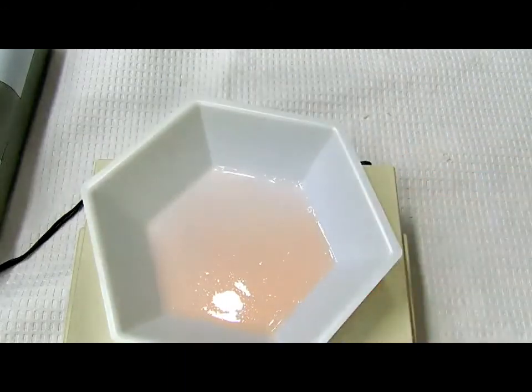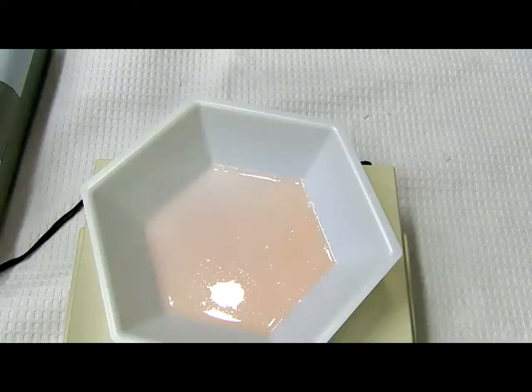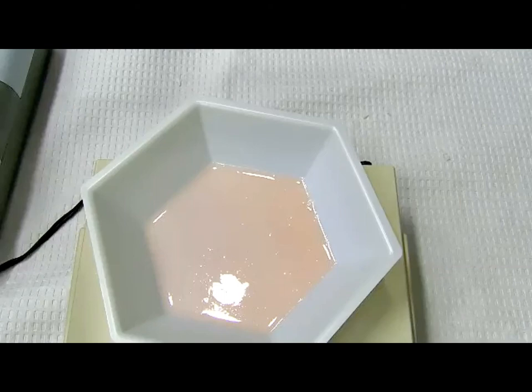And then lastly, you'd want to describe it as easily redispersible. So pink, odorless, opaque emulsion with no visible droplets that is easily redispersible. Because, and let me go ahead and we'll go back to the screen share here. All right, hopefully we're back on there and you can see that description. As Dr. Wu did, she shook really vigorously to mix the oil and the emulsifiers and the external phase, the cherry syrup together and disperse those droplets.